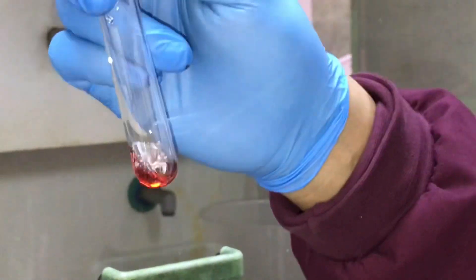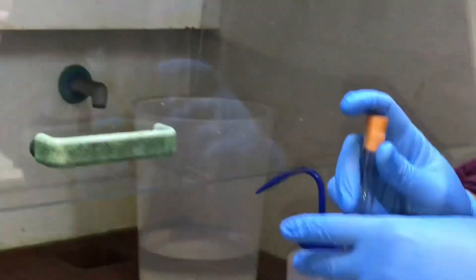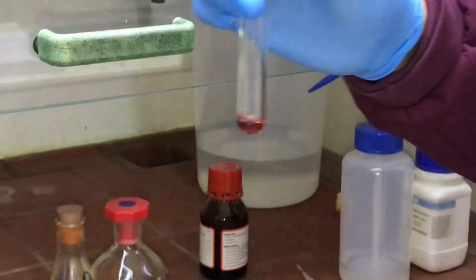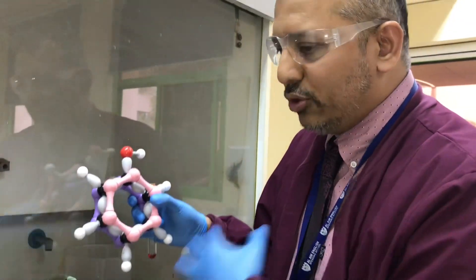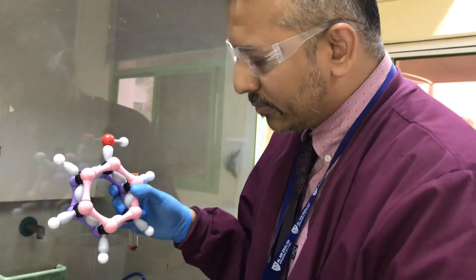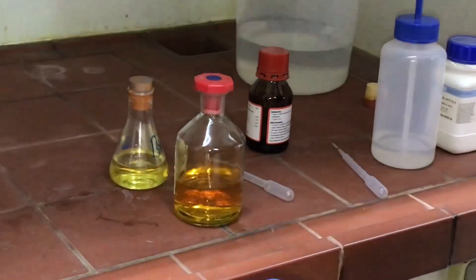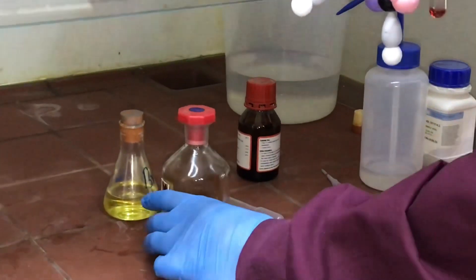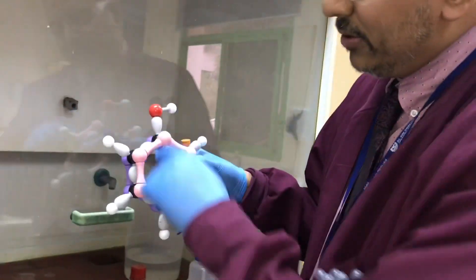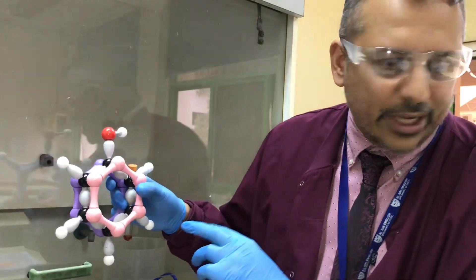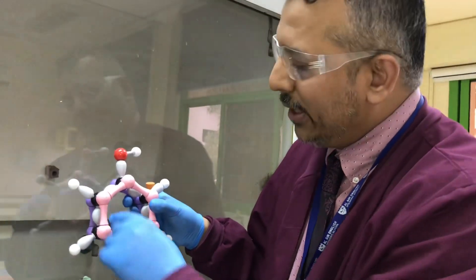One of the things about phenol is this hexagonal shape. In the presence of a chemical called bromine, which is normally a very volatile liquid—I've actually got some bromine water here, I'll do a video on bromine another day—when you have bromine in the presence of phenol, you have a preference of reacting in certain positions.